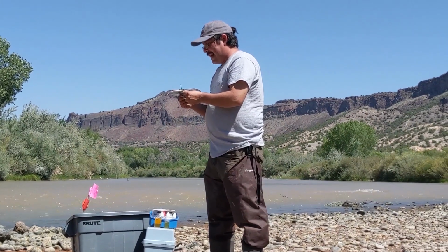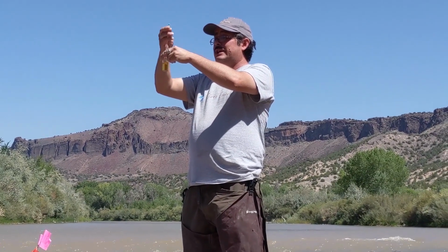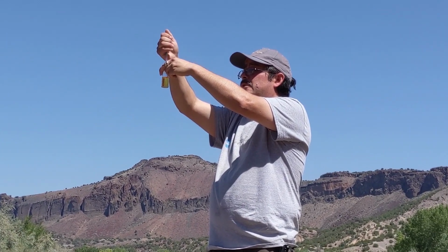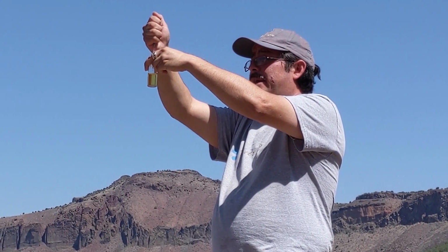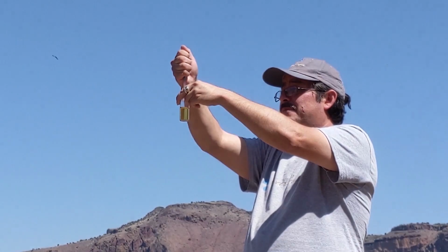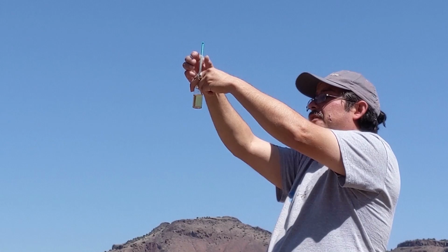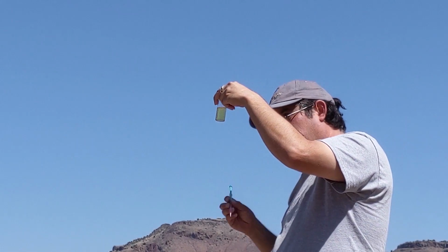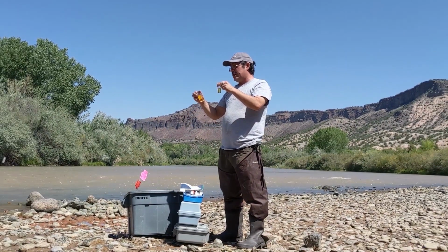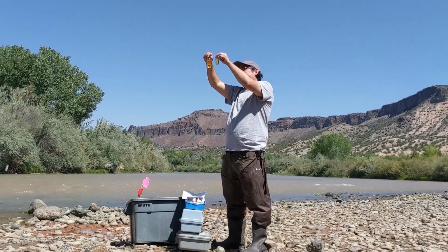And so now it says to titrate until the sample color is pale yellow. When we're titrating, we want to add 1 drop at a time and then shake it. We do not need to remove the titrator. Every time we shake it, we'll just add a drop and shake it. Okay, it looks like my color may be a little bit pale looking or lighter than it was before. One great way to determine if it's more of a pale yellow color is to put your samples next to each other and see what they look like. It does appear to be more pale yellow.